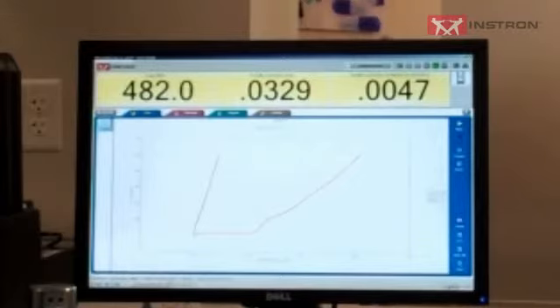Now with the check nuts tightened, run the test up to 500 pounds again. And instead of 31 thousandths of an inch, we're at 4.7 thousandths of an inch. So that was 27 thousandths of compliance that we just removed from the system.